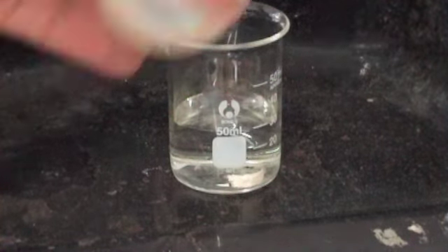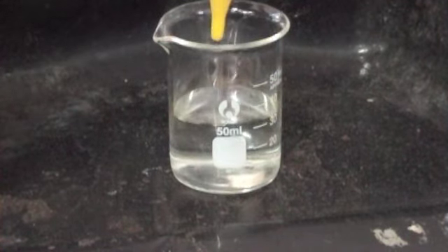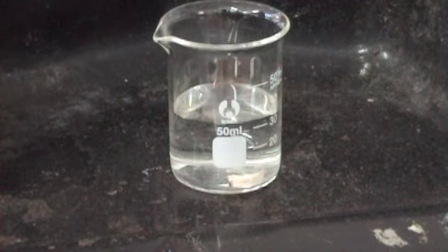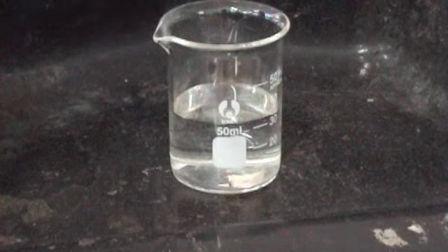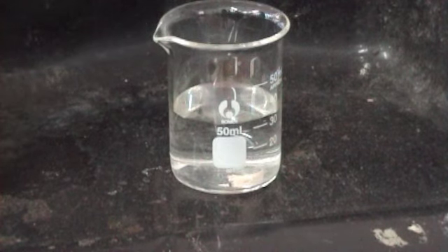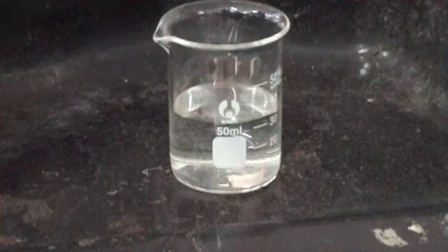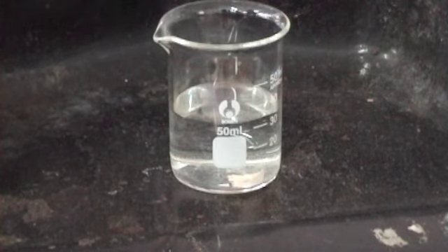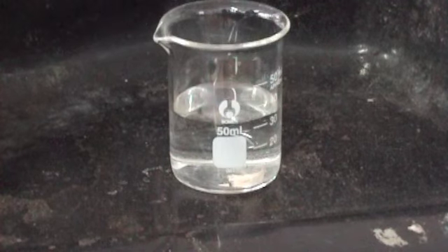Okay. And as we expect, no precipitate with sulfuric acid because magnesium sulfate is soluble. Okay, if it was barium, it would give a precipitate because barium sulfate is insoluble, right? Yeah. So should we mix them in order to find out whether precipitate forms or not? In a test tube, yes you should, and I would recommend the method of holding it and flicking the bottom like that to mix them rather than shaking them like this.